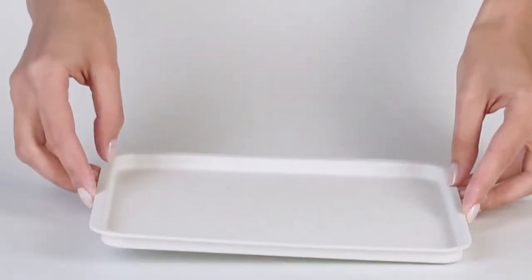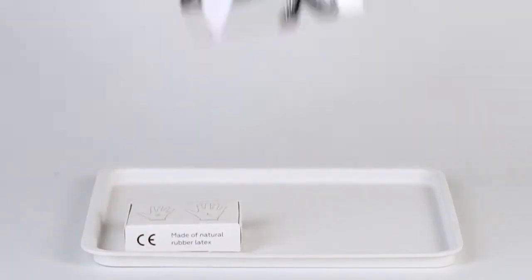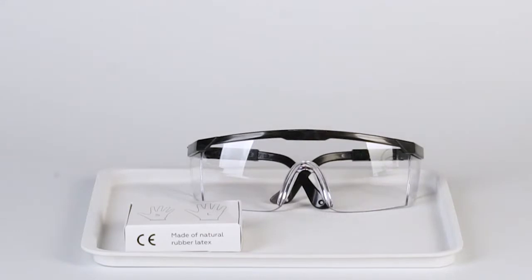Perform this experiment on a plastic tray in order to contain any possible spills. Remember to put on protective gloves and goggles before doing the experiment.